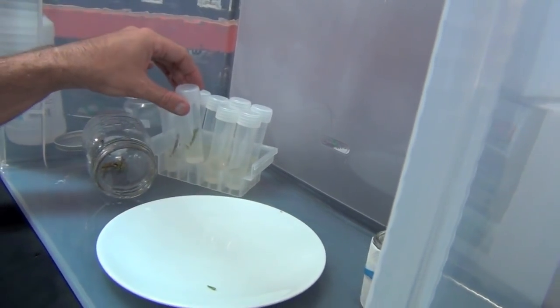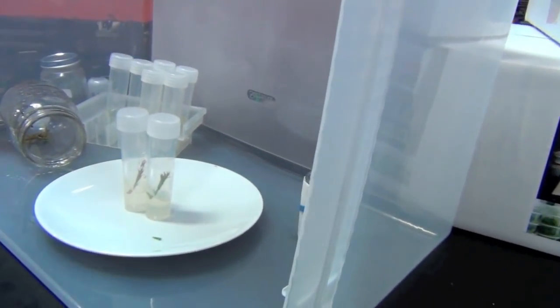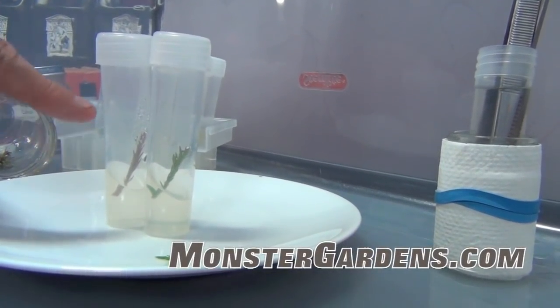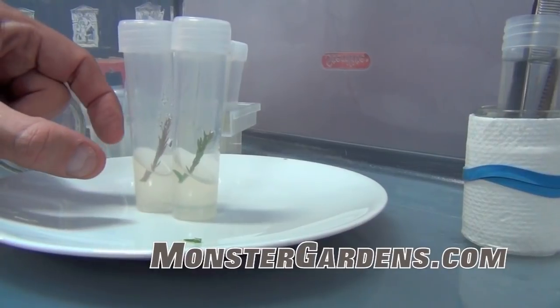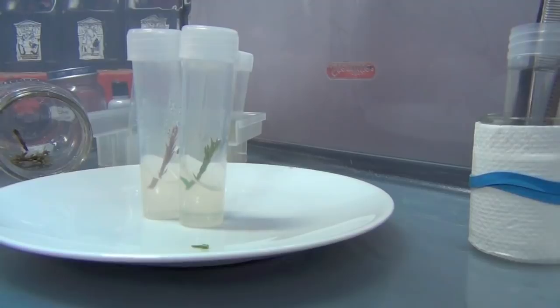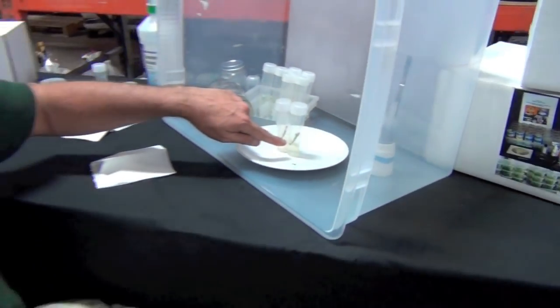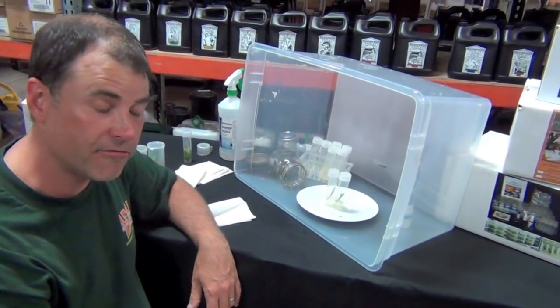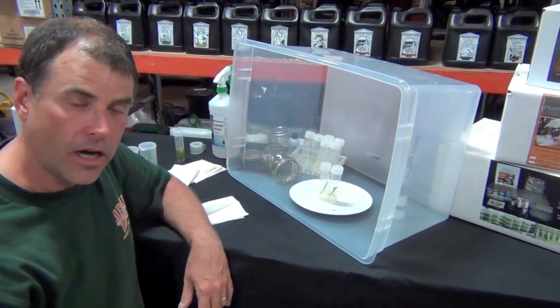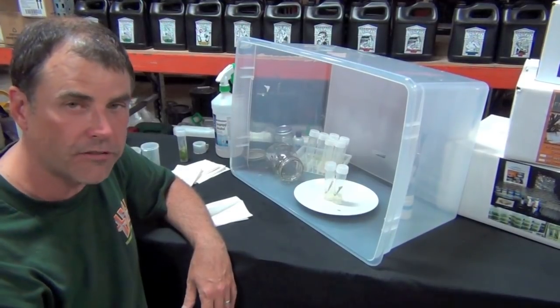Over the next couple weeks, we're going to watch these two plants and look for them to begin to grow taller. The end that's underneath the solution will tend to get fatter because it's beginning to soften and absorb the sugar and nutrients — those are giving it energy to grow and hormones. I'm also watching to make sure that nothing funny grows in there. Things we'll sometimes see are yeast, which can be milky, puffy white fungus, or pink and blue stuff — all bad. Most of the time it just means take another attempt. You might only do four tubes at a time — try four pieces, then a couple days later four more pieces, because you might work slowly the first time.